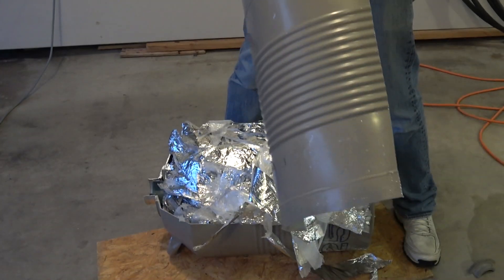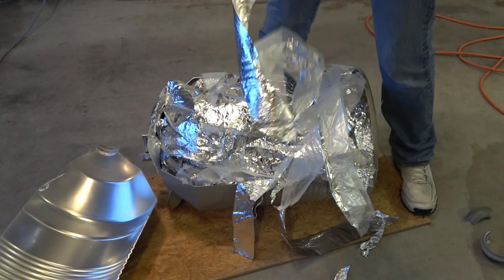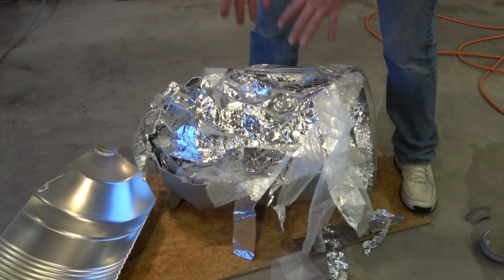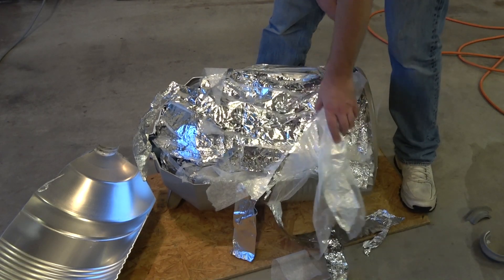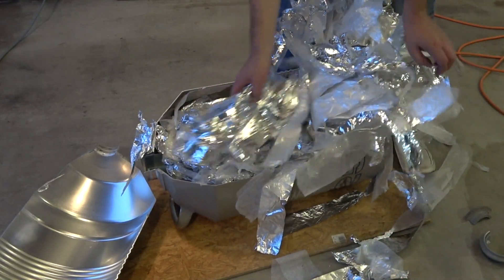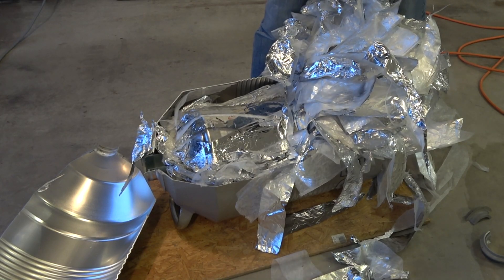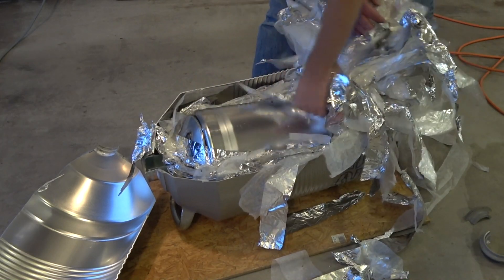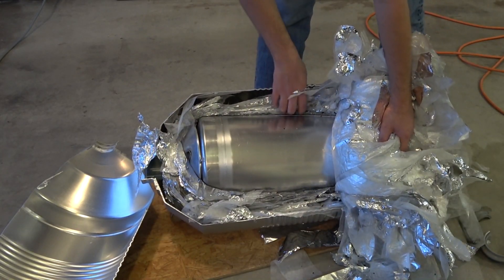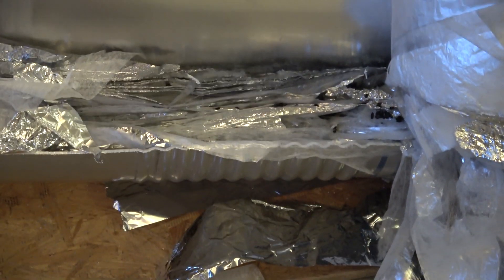Here is the outer skin. Basically it has this aluminum foil stuff inside, which is kind of fun — pure aluminum. And then we have a sled or shield or something. Inside the dewar, we have more of this — it's like a triple layer. We've got something that looks like a dryer sheet, and then some foil. It's just layers upon layers — it's really kind of like space-age insulation. I really expected the inside container to be closer to the outside container, and that's why I was having so much trouble cutting it.